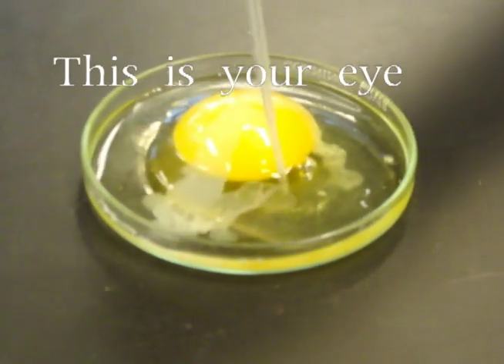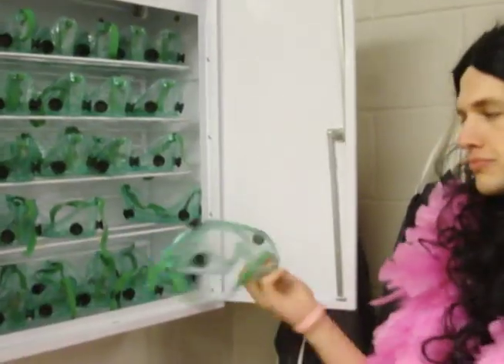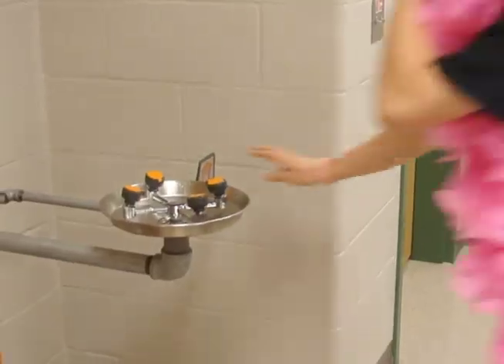Don't wear contacts, it's unwise. They suck in acids and cook your eyes. Wear your goggles at all times, or you'll need Braille to read these rhymes. Chemistry!